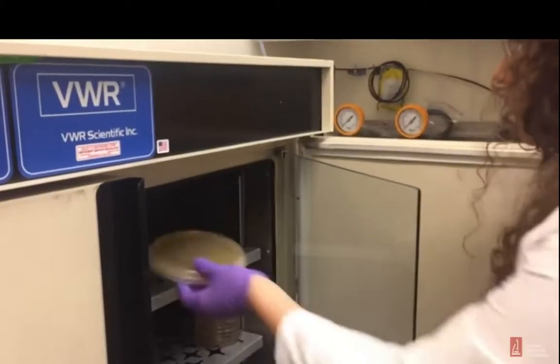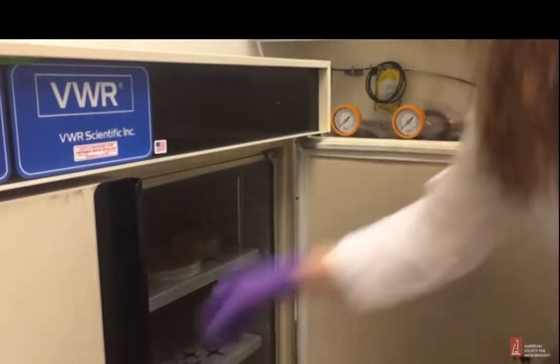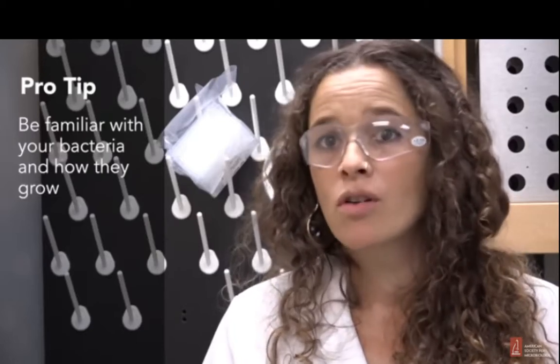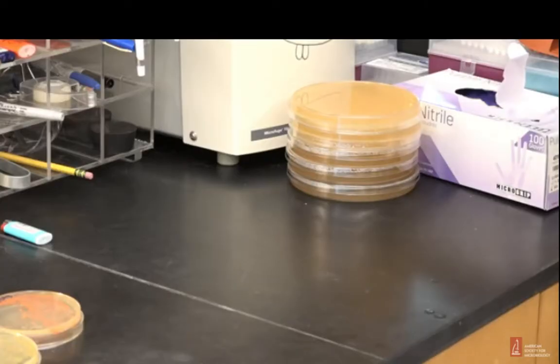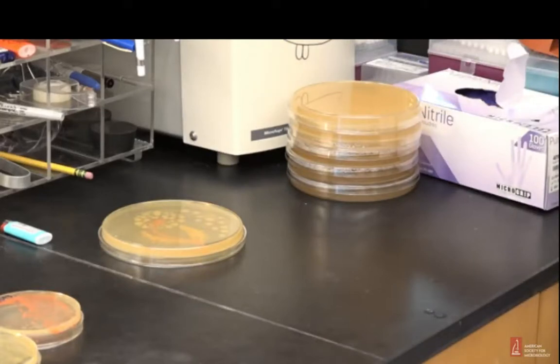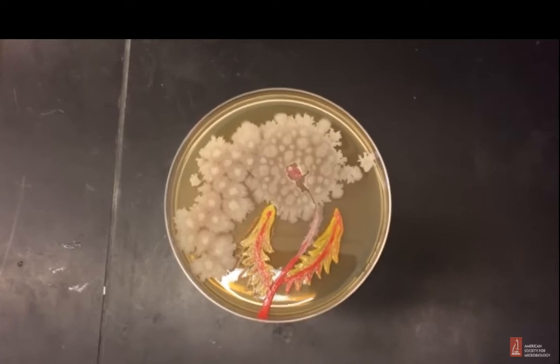Now that I'm done with the drawing, I put it in the incubator for 24 hours. So here is an important tip. Bacteria grows at different rates at different temperatures. So the more you know about the bacteria that you are using, the more control you have over your art. So this is after 24 hours in the incubator, and now I'm going to let it sit for another 48 hours at room temperature. Okay, my piece is finally ready.